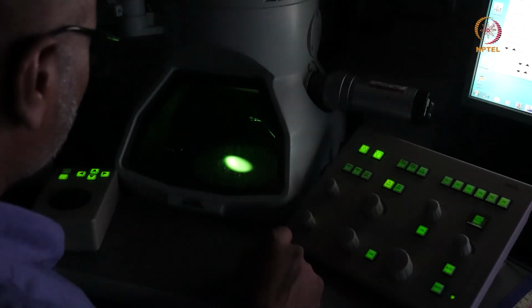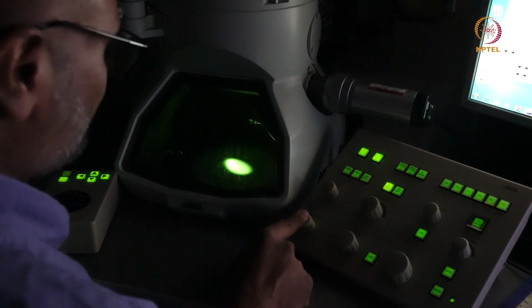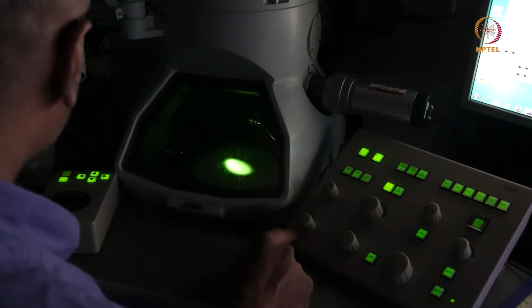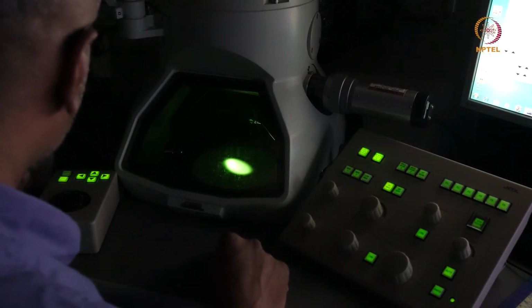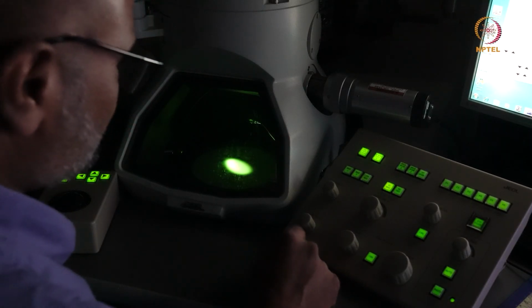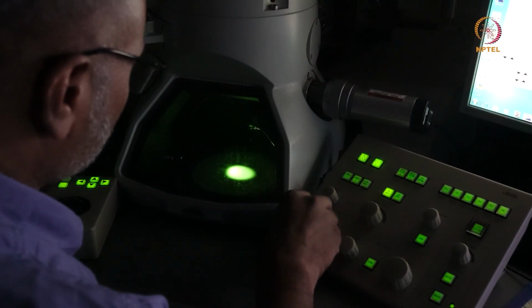If I press condenser stigmatism here, I've shown the layout of the console earlier. After I press the condenser stigmatism, I have to use the deflection or stigmator knobs. Now, in a Thermo Fisher microscope, you would have the condenser stigmator in a window in the software, or you also have it on the console, and you'll enable the multifunction knobs there. Here you enable the deflection or stigmation knob and try to make this as circular as you can.